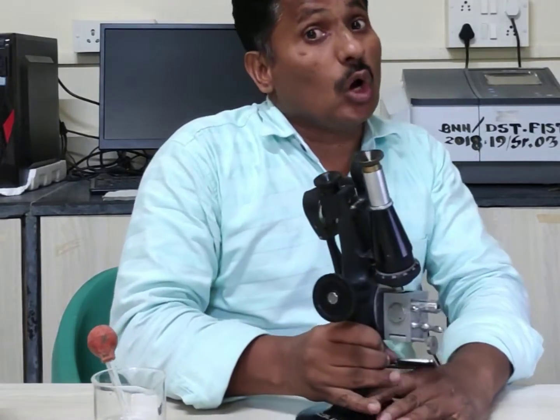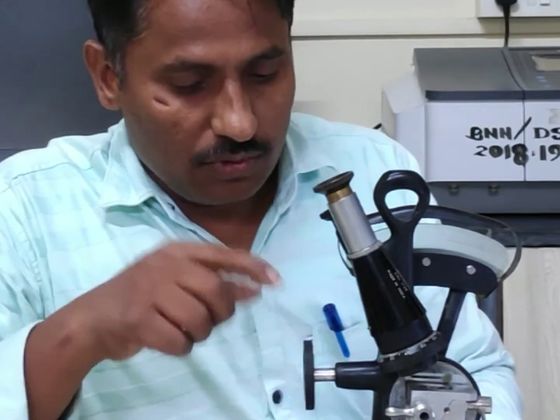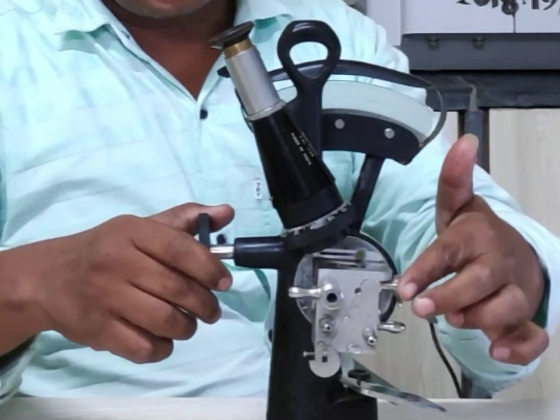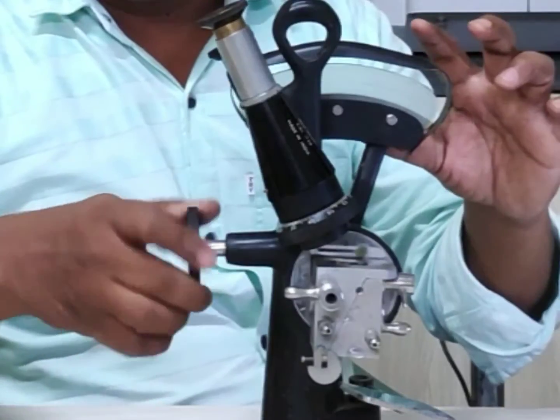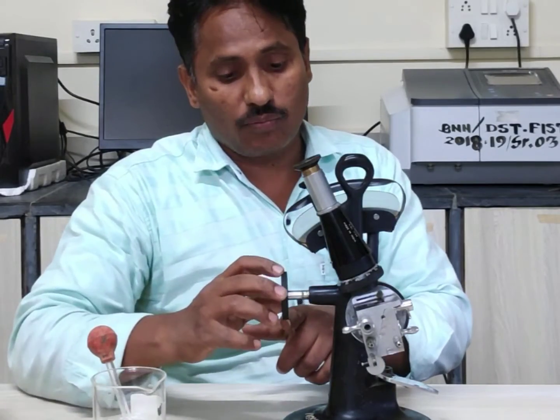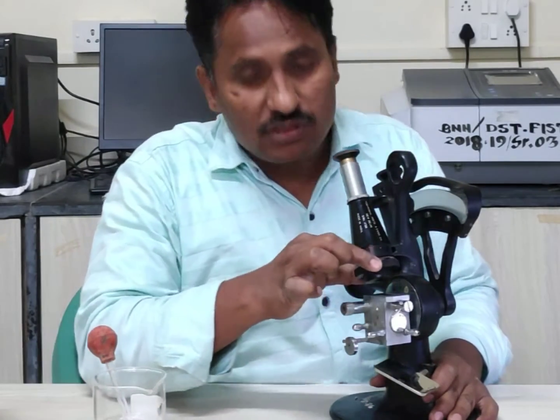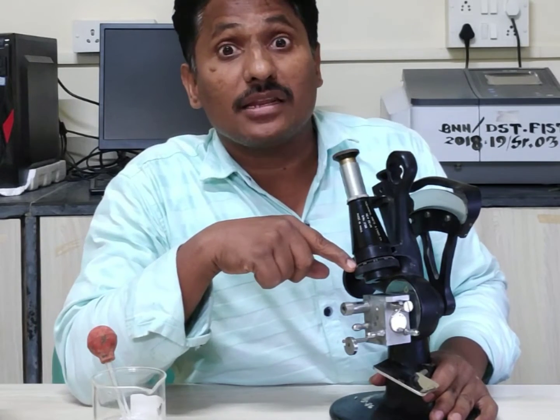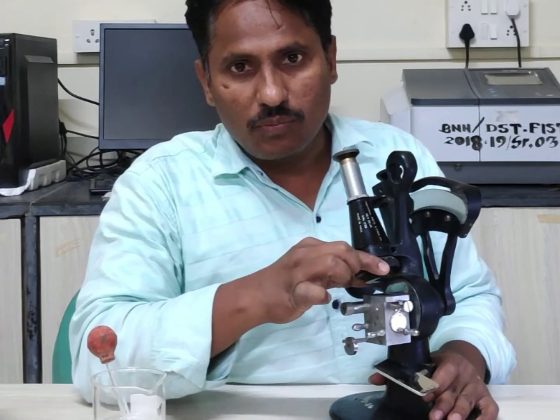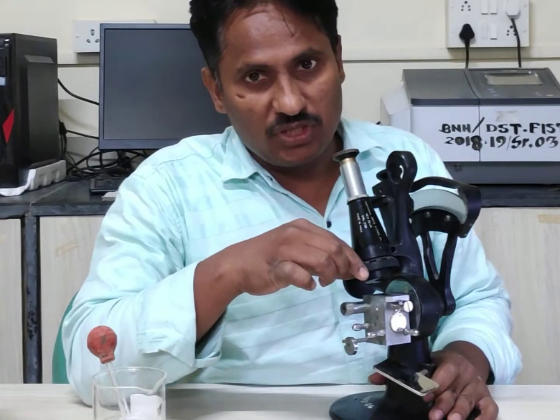There are two important knobs. This is the main knob — when you rotate it, the prism box and scale both move together. This is the main adjustment knob. And this other knob is the fine adjustment knob. For fine adjustment, we can revolve this knob to adjust the scale and our eyepiece precisely.